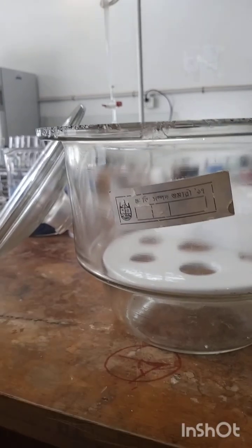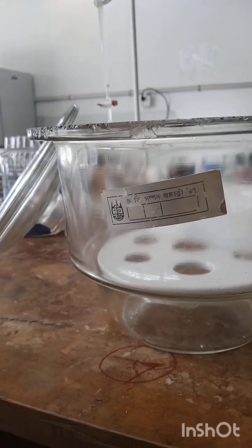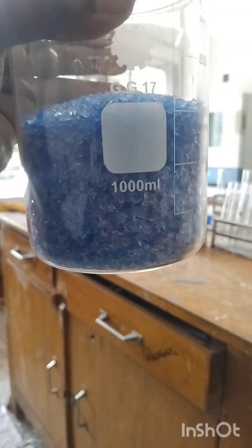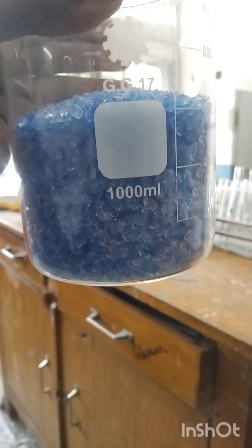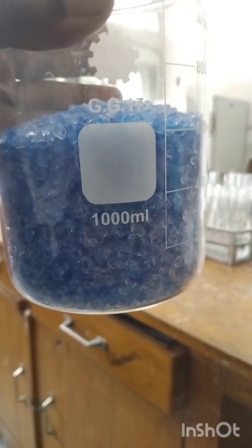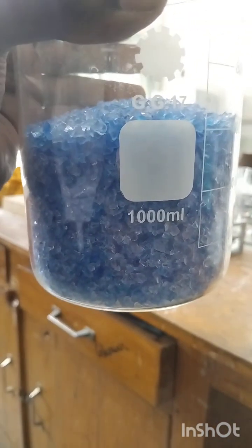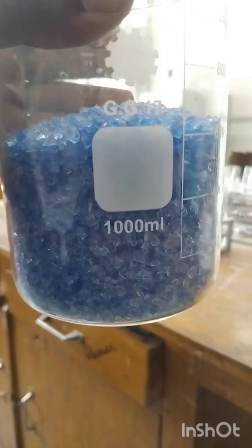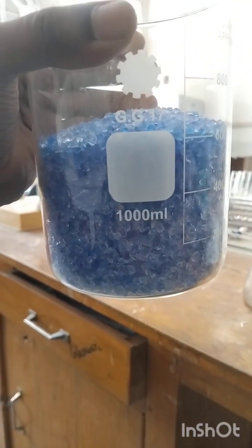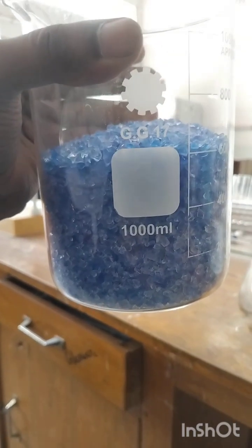Desiccant means a drying material or dehydrating agent. Right now, I would like to show you a dehydrating agent. It's really amazing, and it is called desiccant or blue silica, which is used for dehydration. If you'd like to keep your sample moisture free, then this dehydrating agent or desiccant is used. And you can use another desiccant, like anhydrous calcium chloride, anhydrous magnesium chloride.